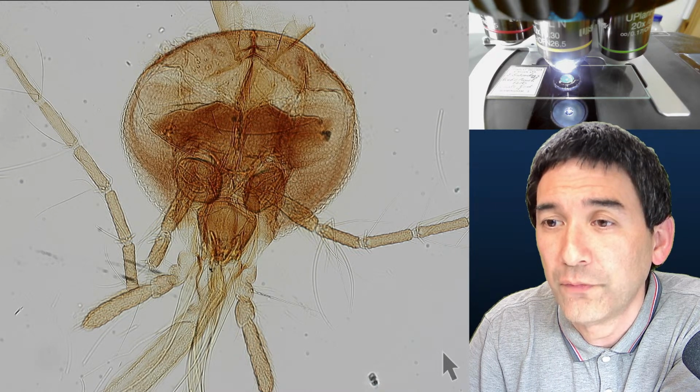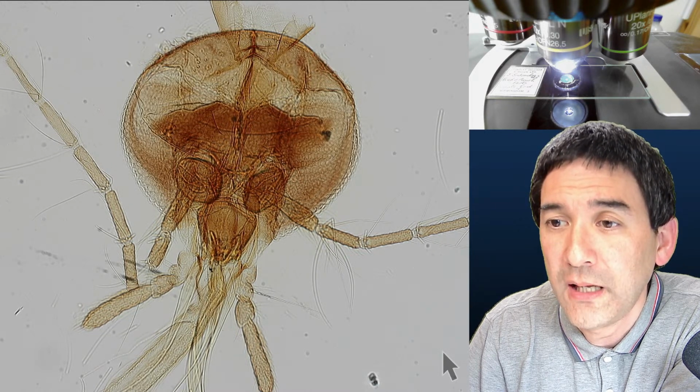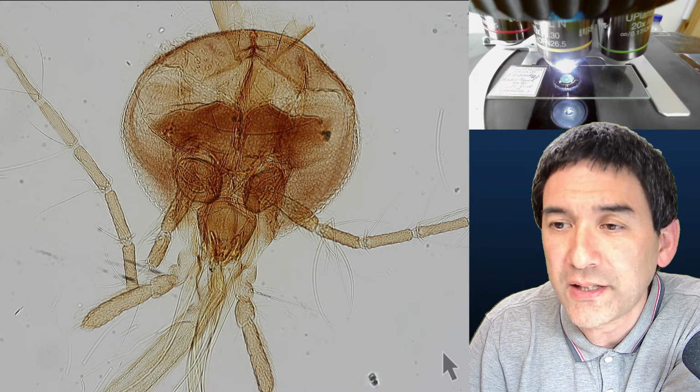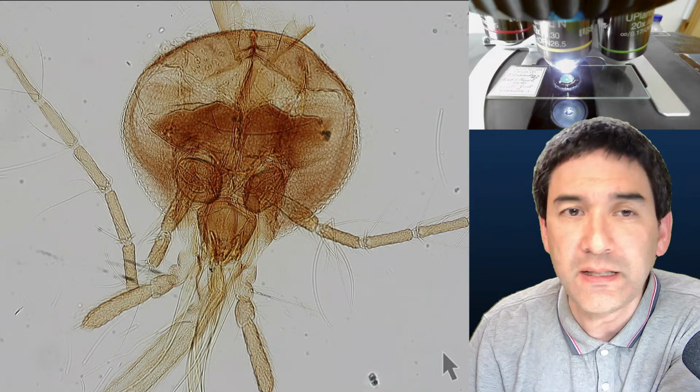Okay, you cannot go faster than the shutter speed. That's correct. Yeah, panning and digital movement over the image is also part of my software. Also, I can control the slide movement with my software. So that's also actually something that I've been thinking about a little bit.